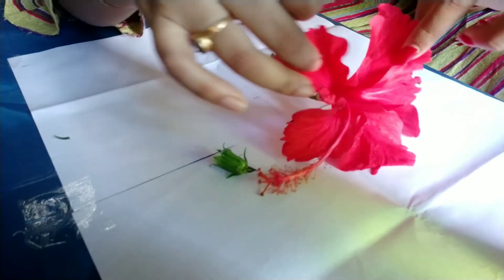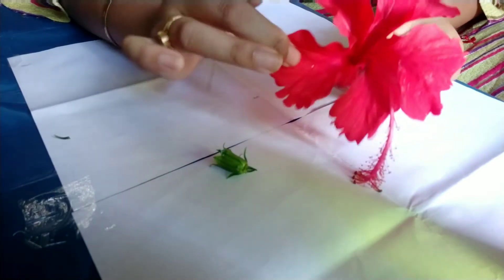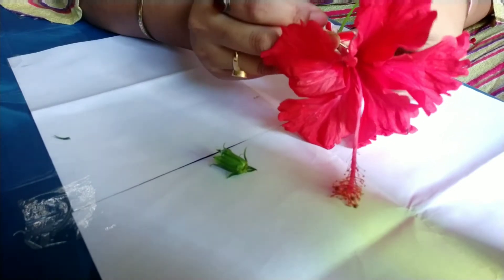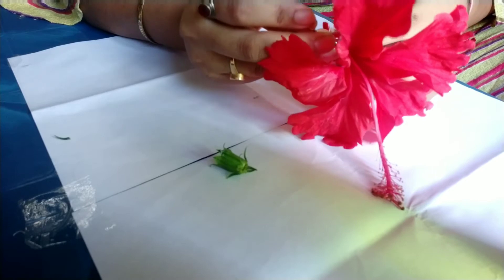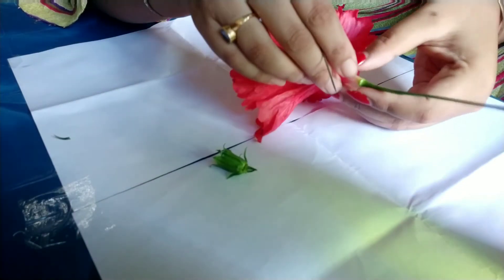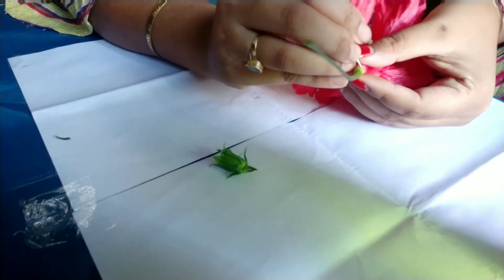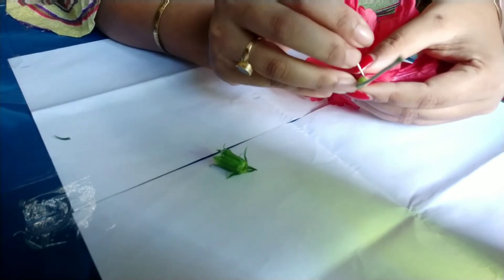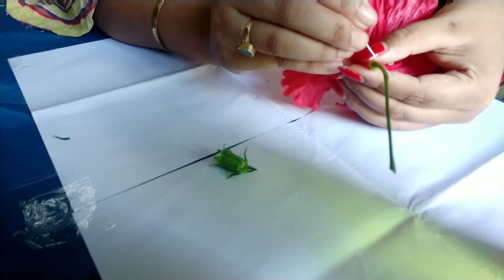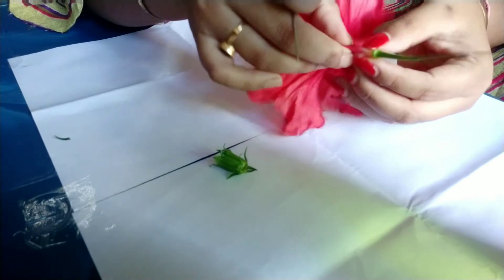Now the next part — I'm going to separate the petals. The petals are the red part and the most attractive part of the flower. You have to be very patient while doing it; don't be in any hurry and don't put much pressure with your needle. You can use your hand in between, but be careful. Don't cut the whole petal — just make a slight mark so that the petal comes out together. I'm trying to cut it very fine.